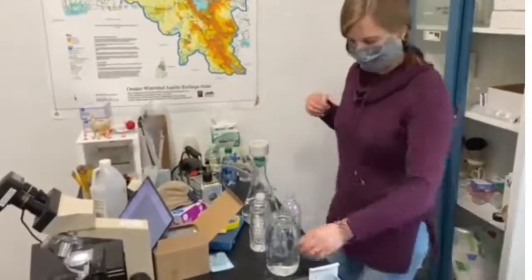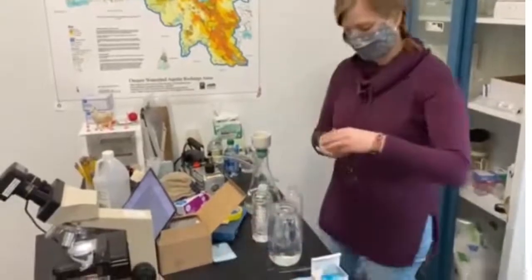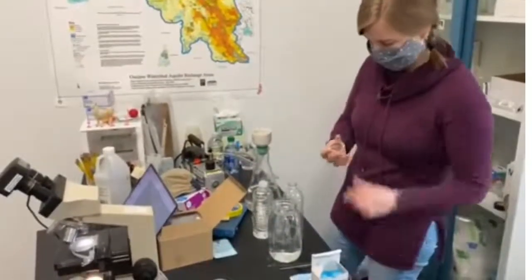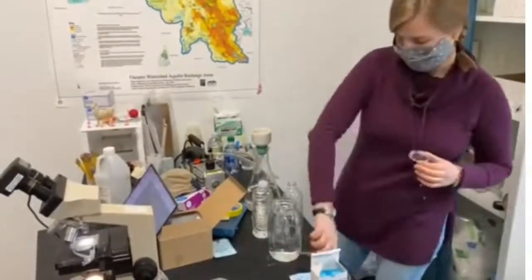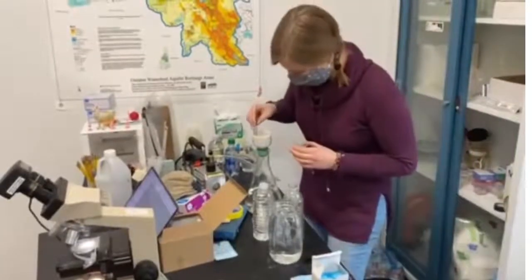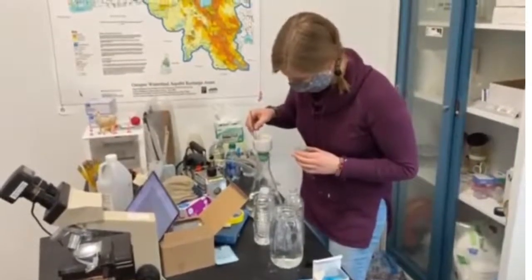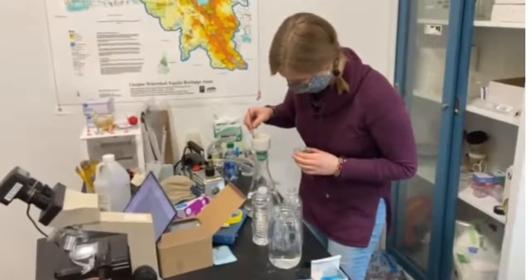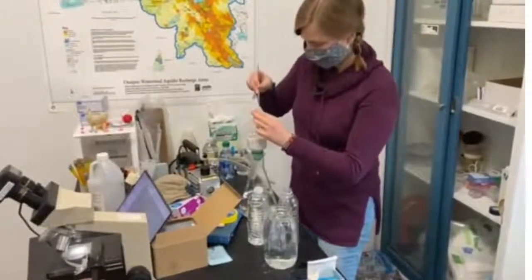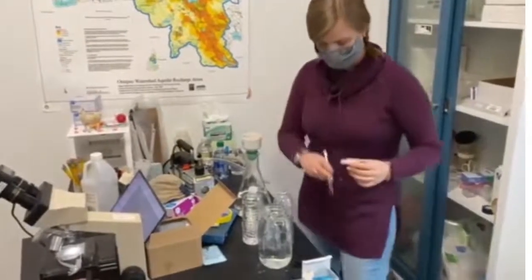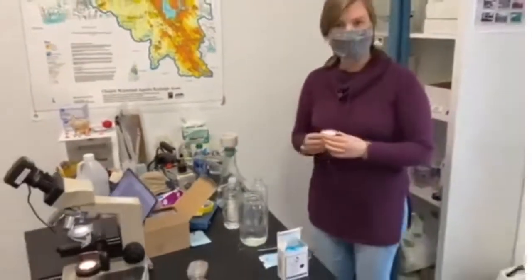Now we have our sample on our piece of filter paper. I'm going to take that out of here. I have to release the suction first. And now we're going to look at this under our microscope.